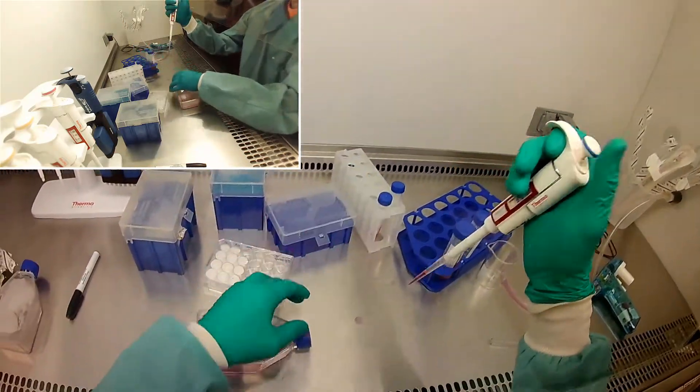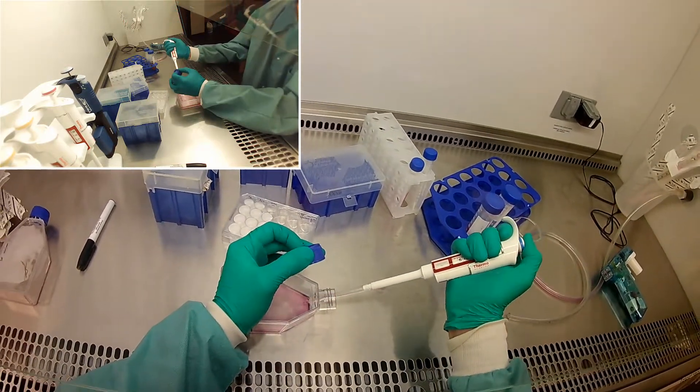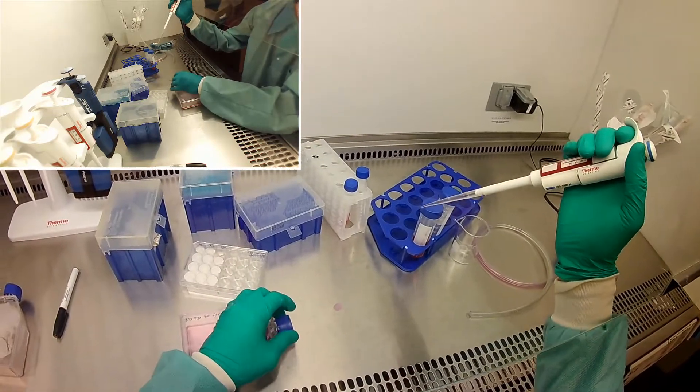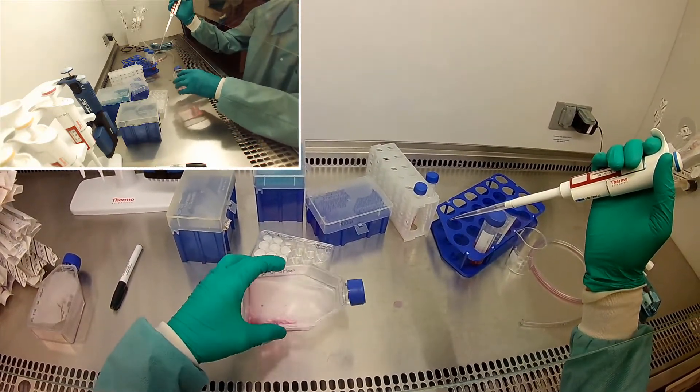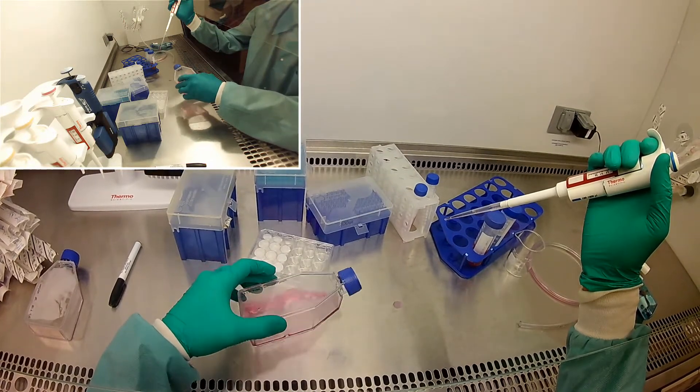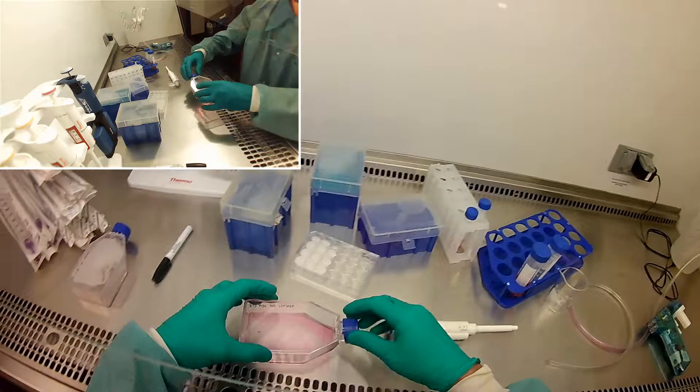So I'm going to be really careful about what's going on with my tip over there. I'm going to make sure this stays sterile. Push that in there. Mix it up well, and then we'll go ahead and put this in our incubator.